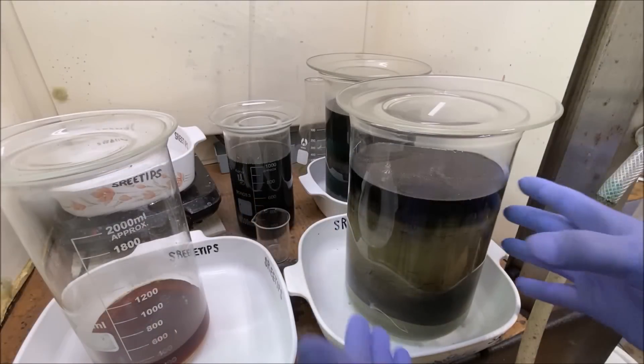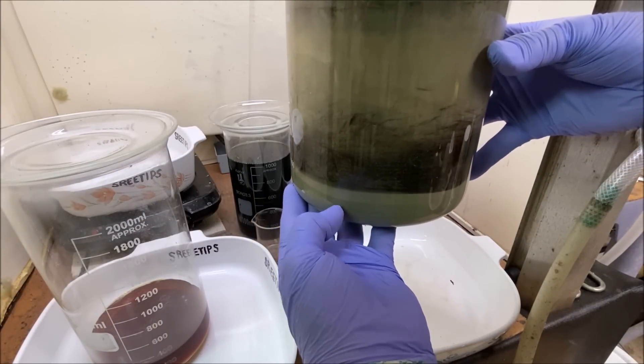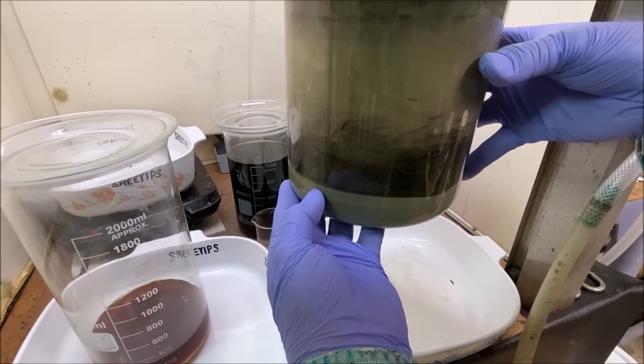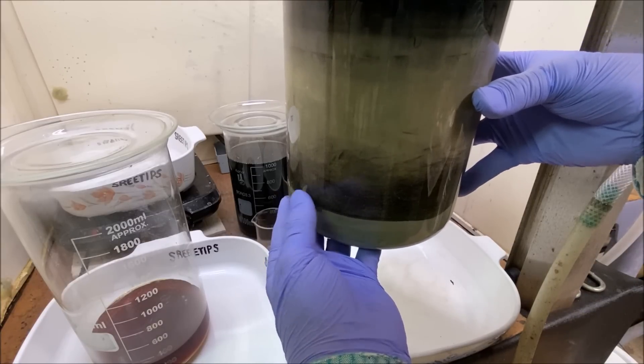So these solutions are devoid of any precious metals. I've got silver down here — I'll recover that, rinse all the liquid off of it, save it, and then we'll melt this up with the shot and run it through the silver cell. Now I'm just going to get these out of the way.